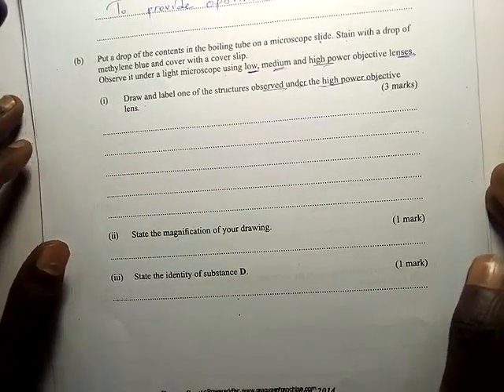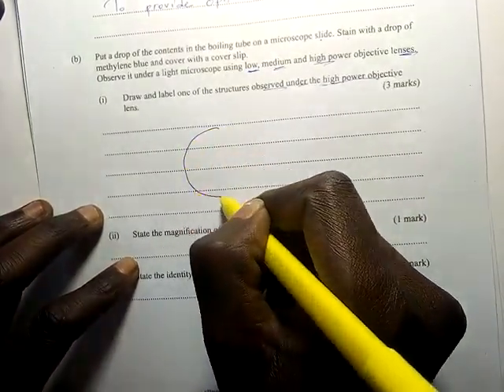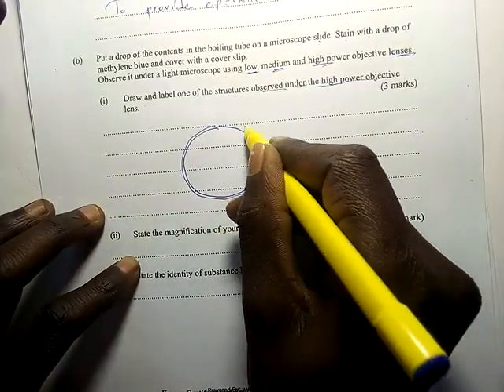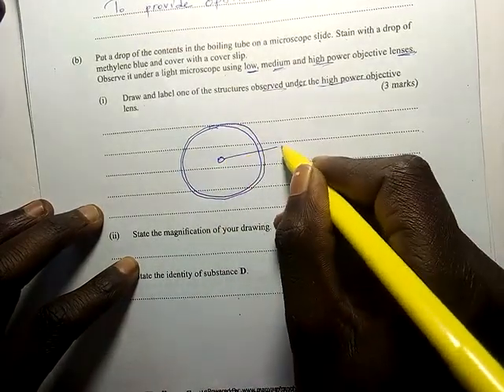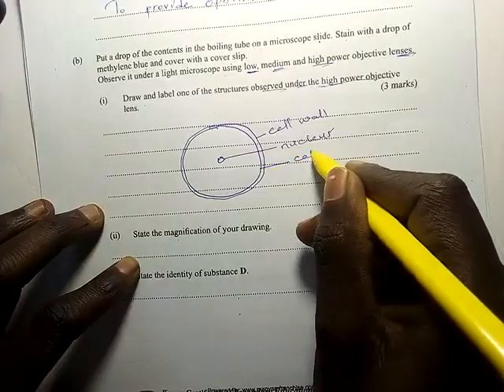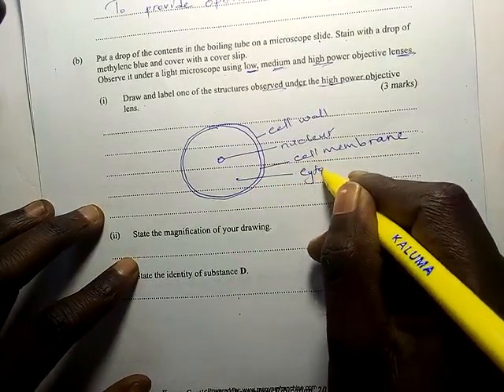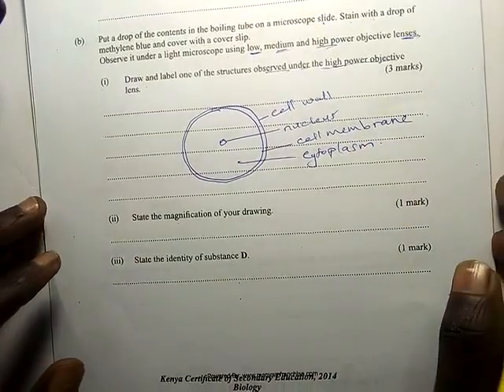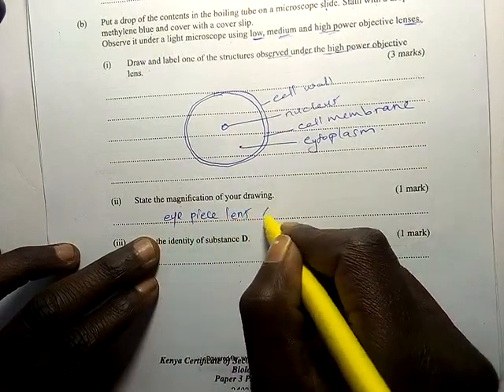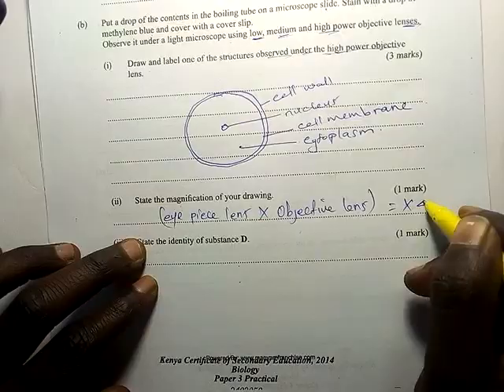We don't have a microscope here, but I will show you the expected observation. You would see a structure like this — a yeast cell structure. There is a nucleus, the outer layer is the cell wall, the inner layer is the cell membrane, and the inner fluid is the cytoplasm. State the magnification of your drawing: you multiply the eyepiece lens by the objective lens to get the magnification, which was times 400.